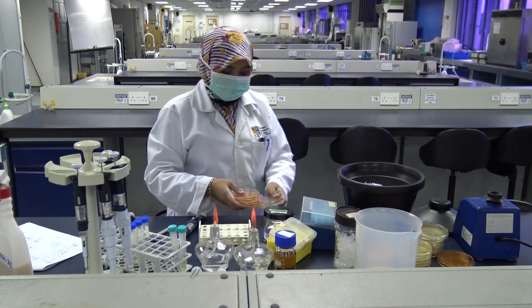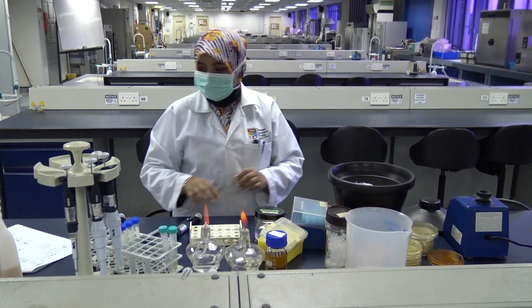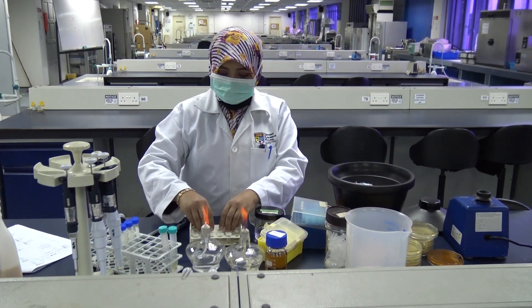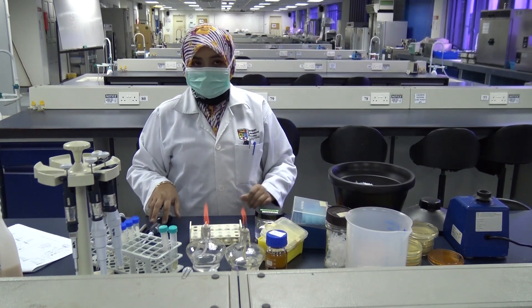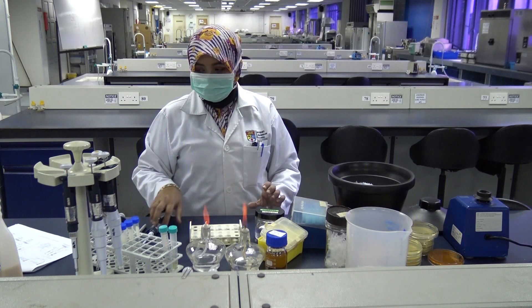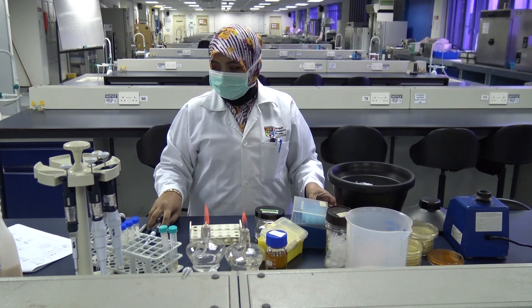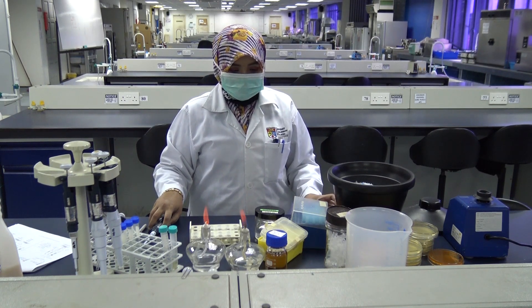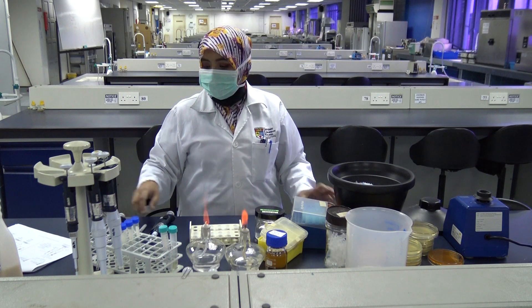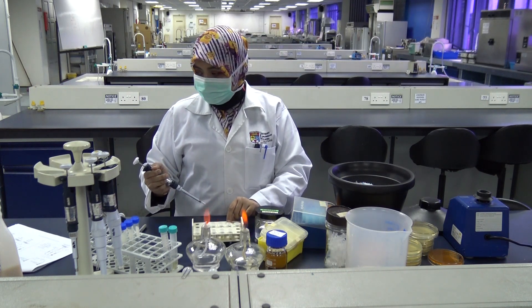Once again, when all your plates are dry, invert them and put them in the incubator until tomorrow. The next day you will have to come and count the colonies. You will have to determine the original titer of your bacterial recipient and donor cells, and finally calculate the percentage of transconjugants.